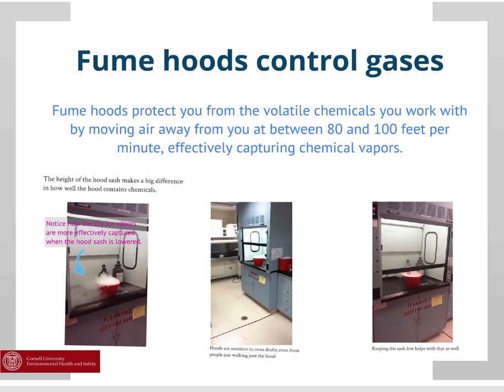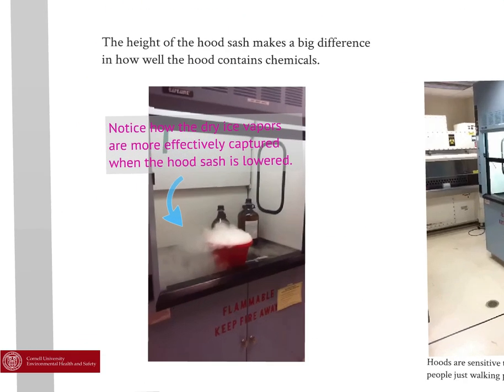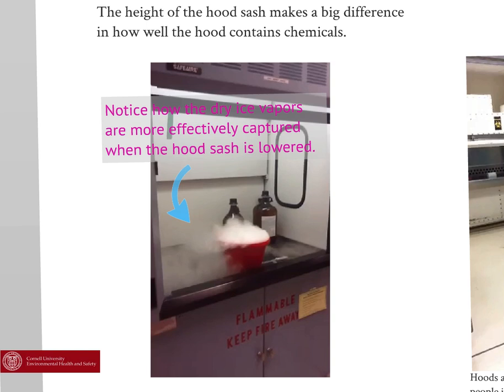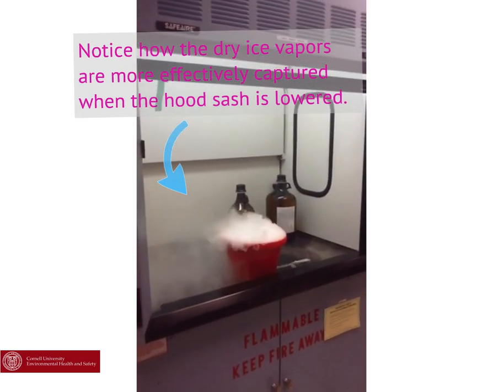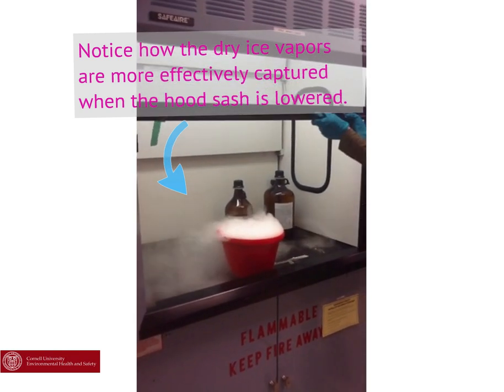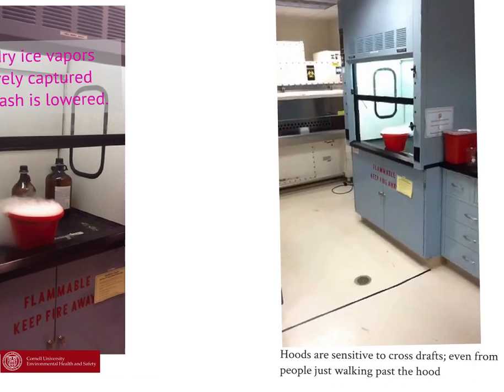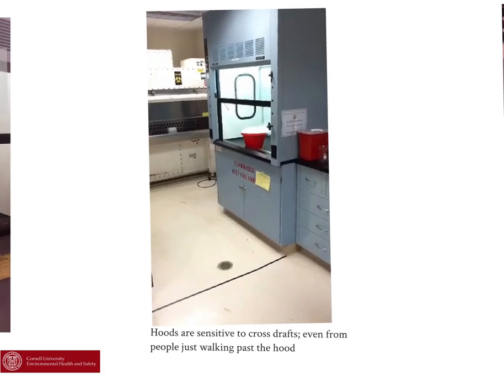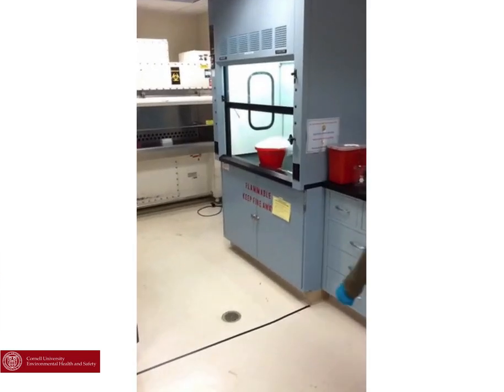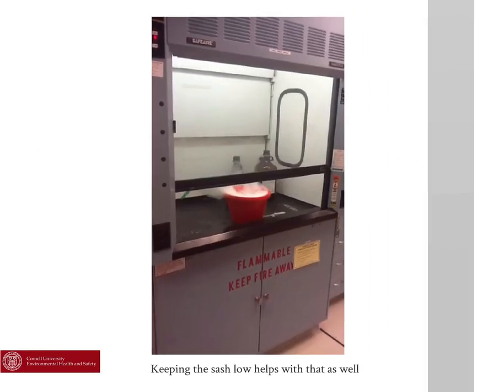Fume hoods control gases. Fume hoods protect you from the volatile chemicals you work with by moving air away from you at between 80 and 100 feet per minute, effectively capturing chemical vapors. The height of the fume hood sash makes a big difference in how well the hood contains chemicals. Fume hoods are sensitive to cross-drafts, even from people just walking past the hood. Keeping the sash low helps with that as well.